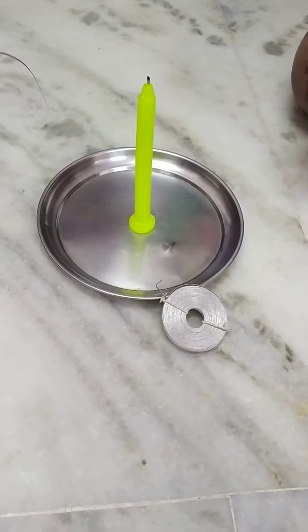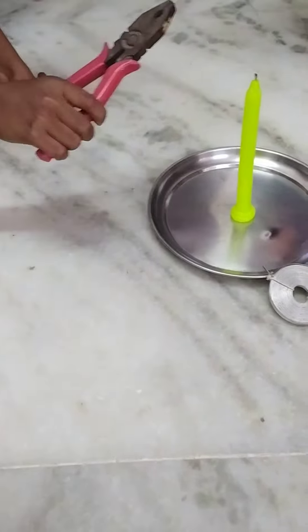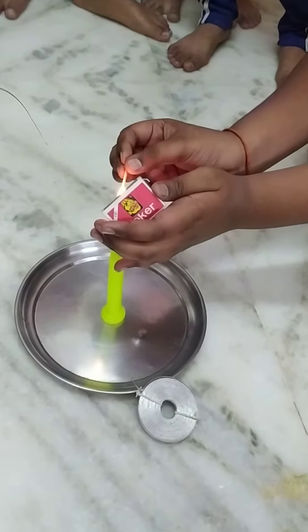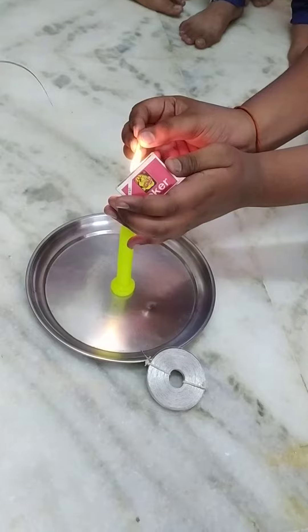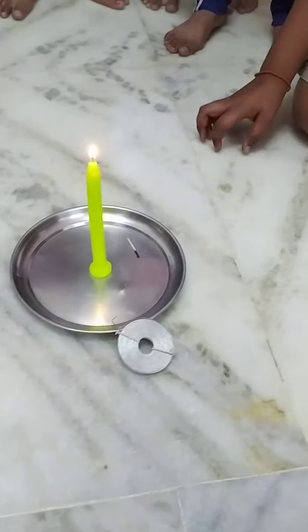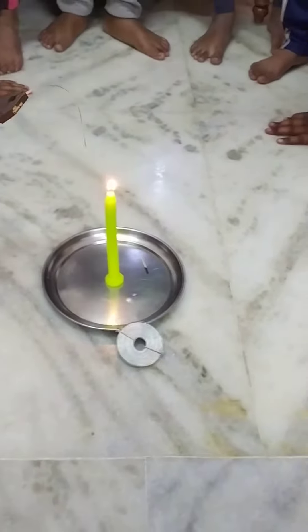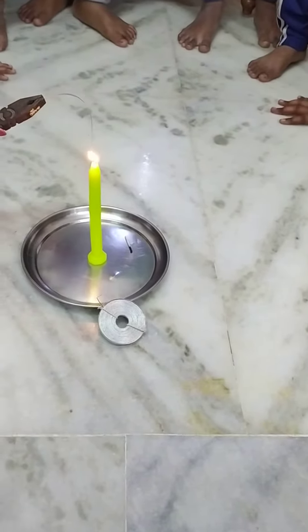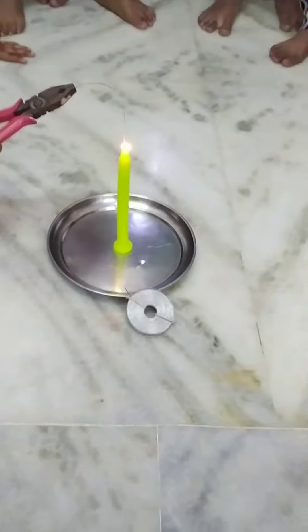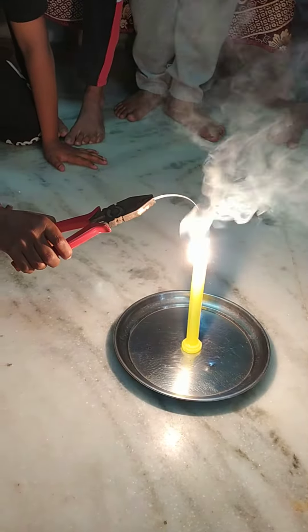While burning, be very careful. Be very far — maintain some distance. Now start. Maintain some distance. It gives a dazzling white flame when it burns. Some fire — start. Nothing will happen, don't worry. You see, it's burning with a white dazzling flame.